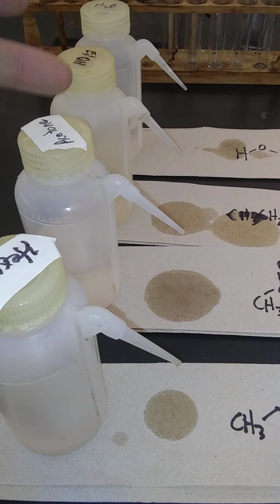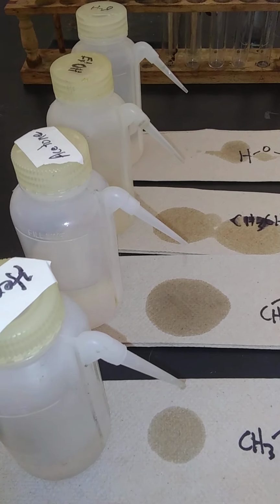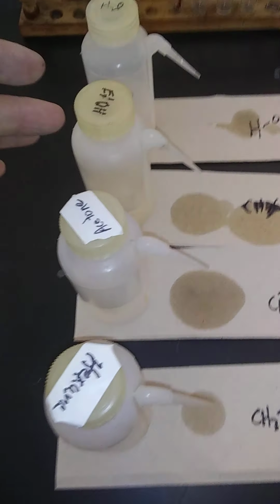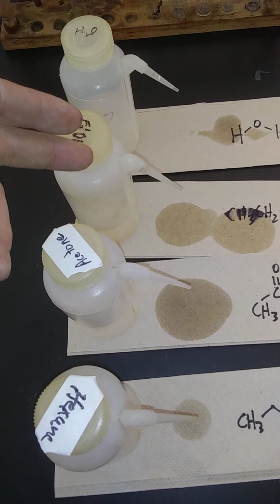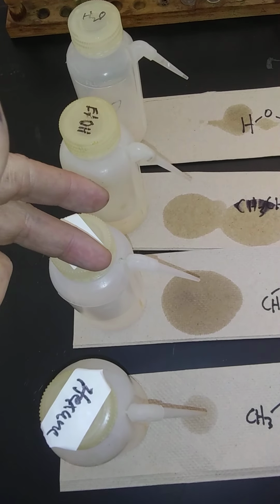I'm going to do the hexane, and not squeezing hexane or acetone, and they are dripping. So the first 2, ethanol and water, I had to squeeze them to get them to drip. I squeezed the water, but it didn't drip any more beyond that. As you can see, there's nothing left. But the ethanol dripped a little bit. The acetone's continuing to drip. It's made a bigger drip mark than the ethanol.